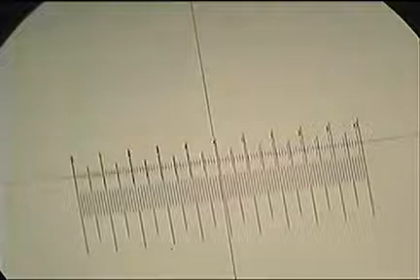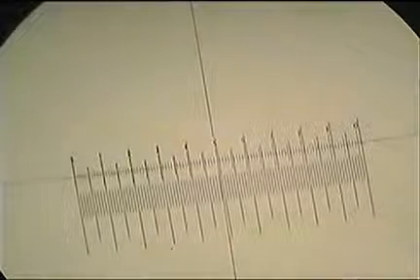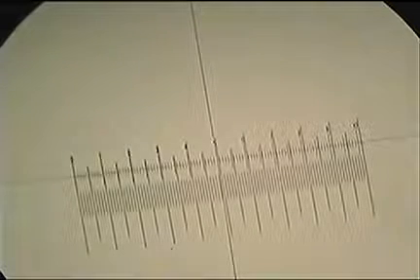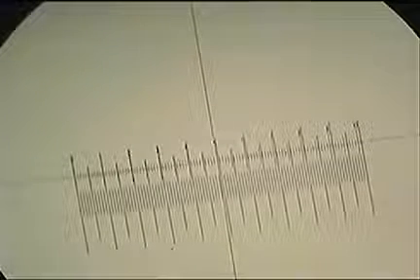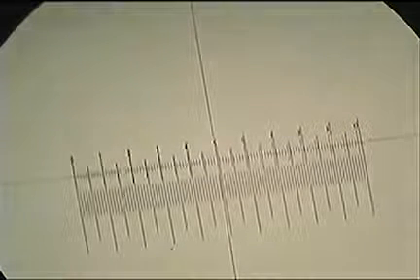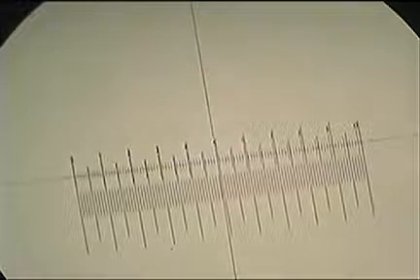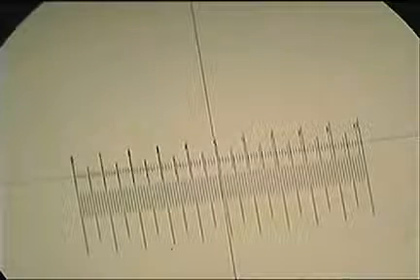Well, looking at that, we've got 9 of our larger units, so those are 0.1 each. So we've got 0.9, and then I've got another, basically 5 of the little units, to the slightly shorter line, which would be 0.95. So the whole thing is 1 millimeter. So just coming back 5 of the smallest units to the slightly shorter, larger line is 0.95 millimeters.